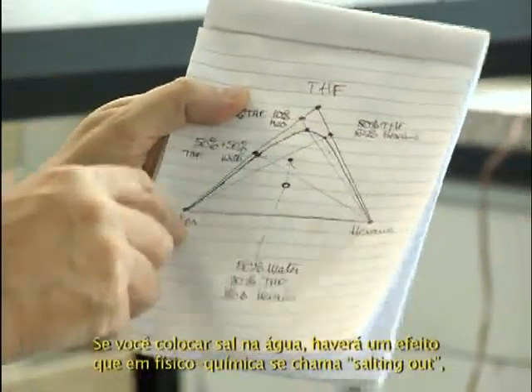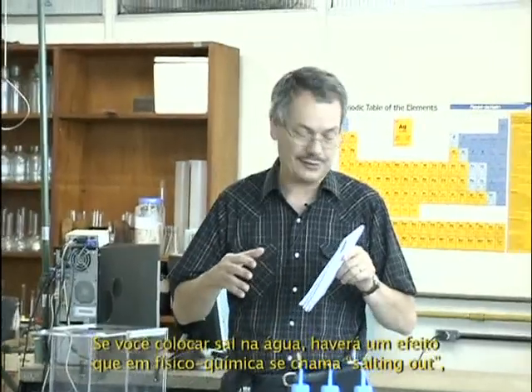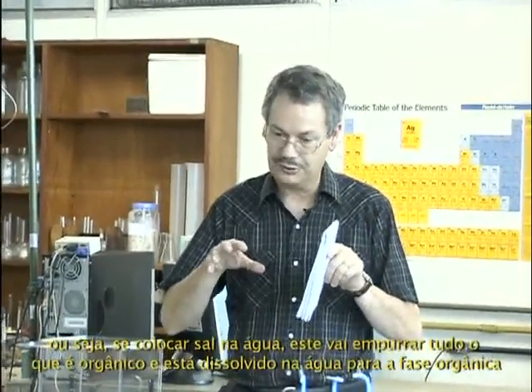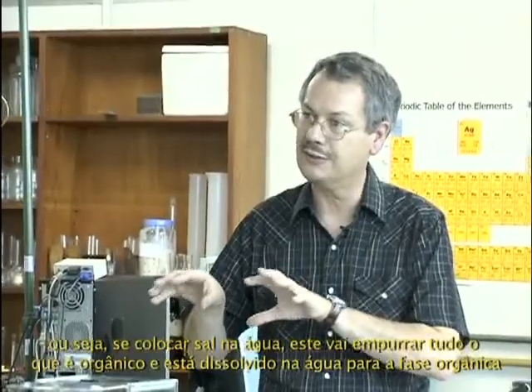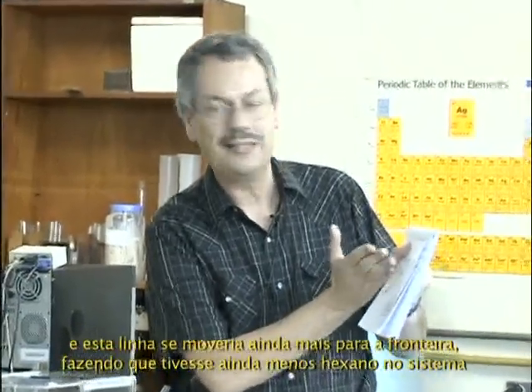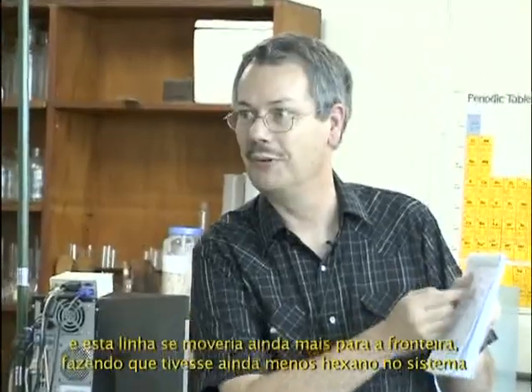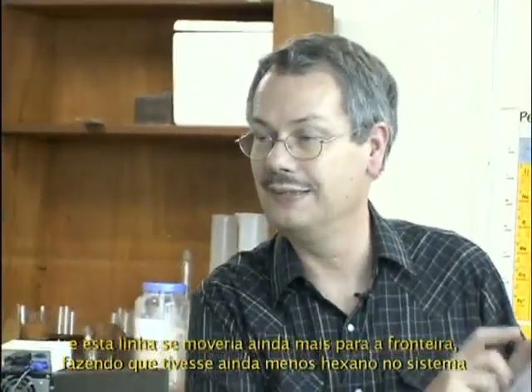If you put salt in water, you get a physical chemistry effect which is called salting out. The salt is pushing everything organic which is dissolved in water into the organic phase. So it would move this line even closer to the border, making even less hexane in the system.